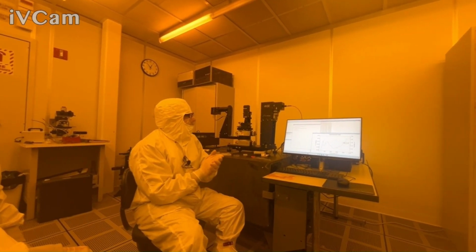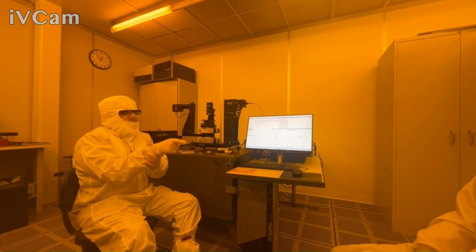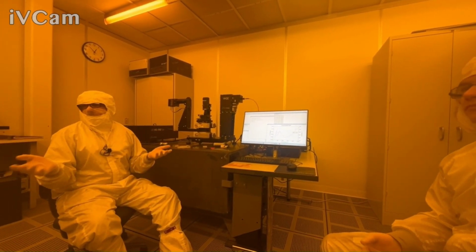All right, so that looks good. And you said you want to wait till tomorrow. Do you want to start a different sample now?